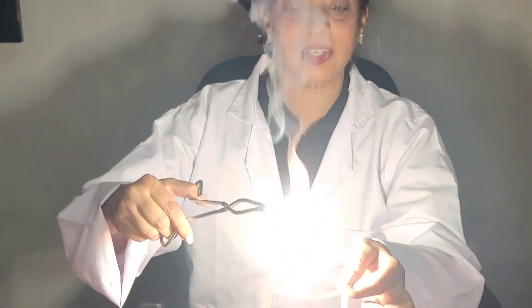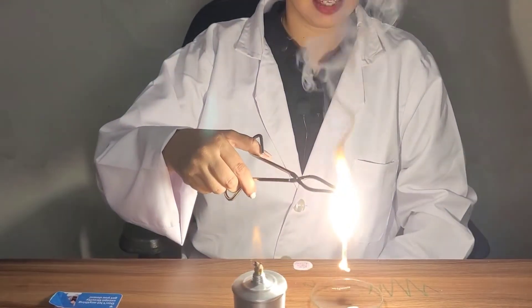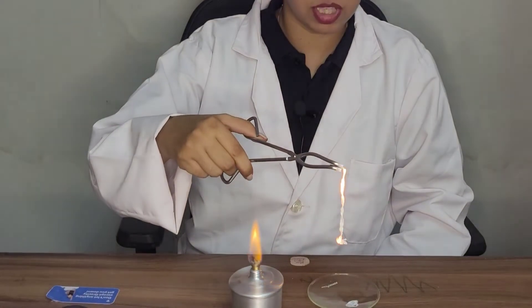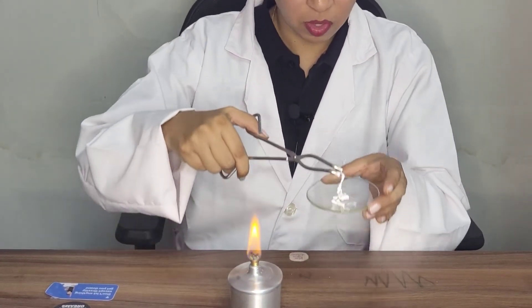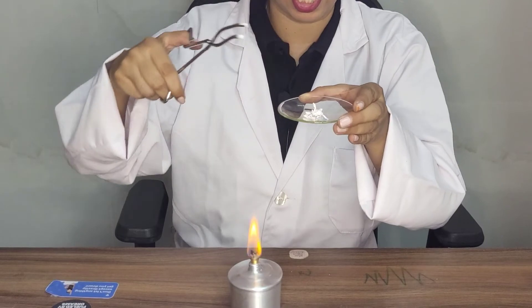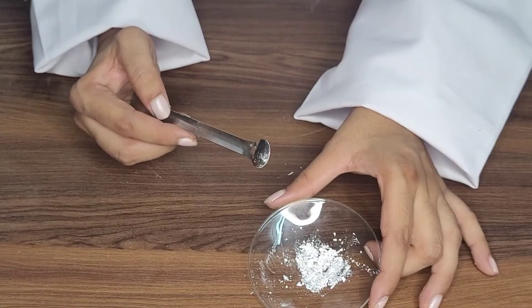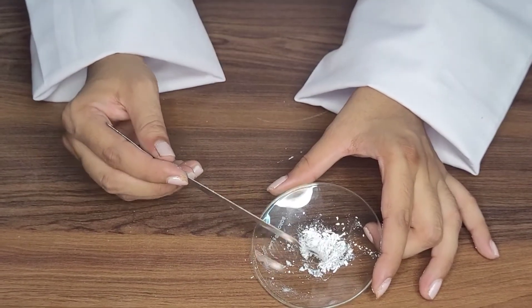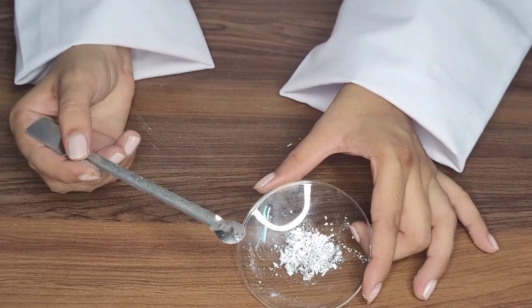Now it is burning like a firecracker and you have to save this ash in a watch glass. So I am taking the ash in the watch glass. Can you see this ash is a white colored powder of magnesium oxide. So you can see this is the ash which is magnesium oxide. It is a white colored powder.